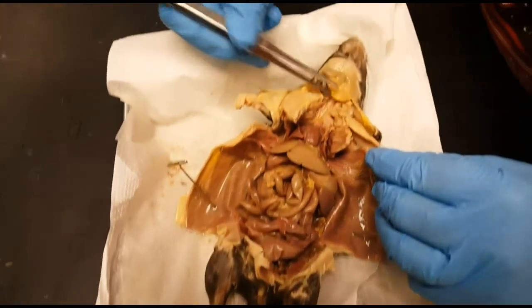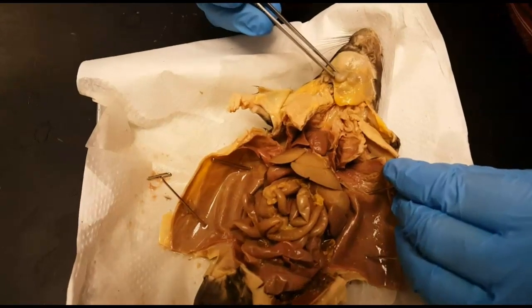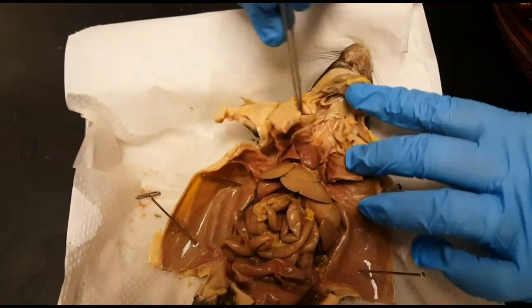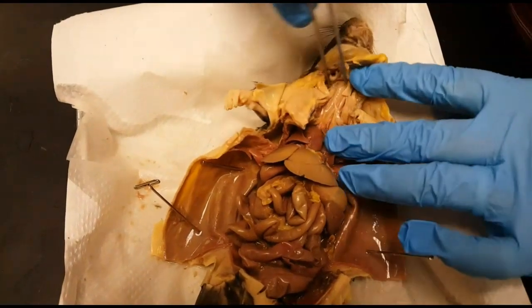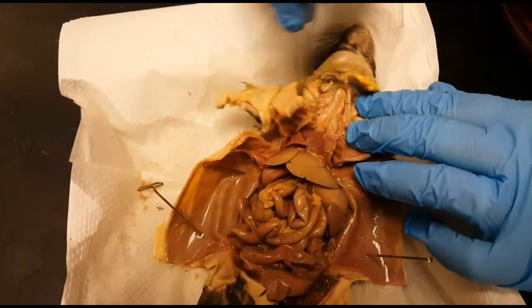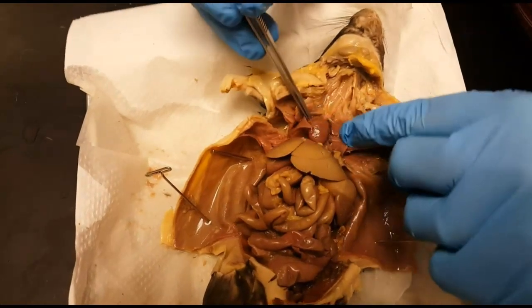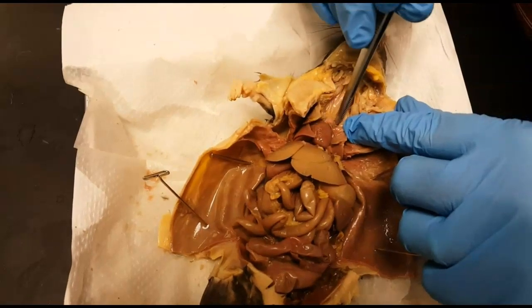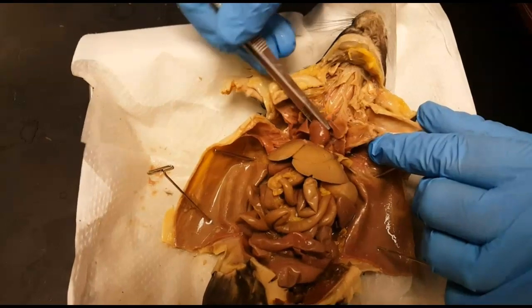Here we have a dissected rat. At the top we have salivary glands with two lymph nodes embedded inside. Inferior to that we have a long hollow tube made up of cartilage rings called the trachea. Posterior to that we have the long tube called the esophagus, made up of smooth muscle. Inferior to that we have an artery coming out of the heart called the aorta, and two branches extending into the neck called the left and right common carotids.